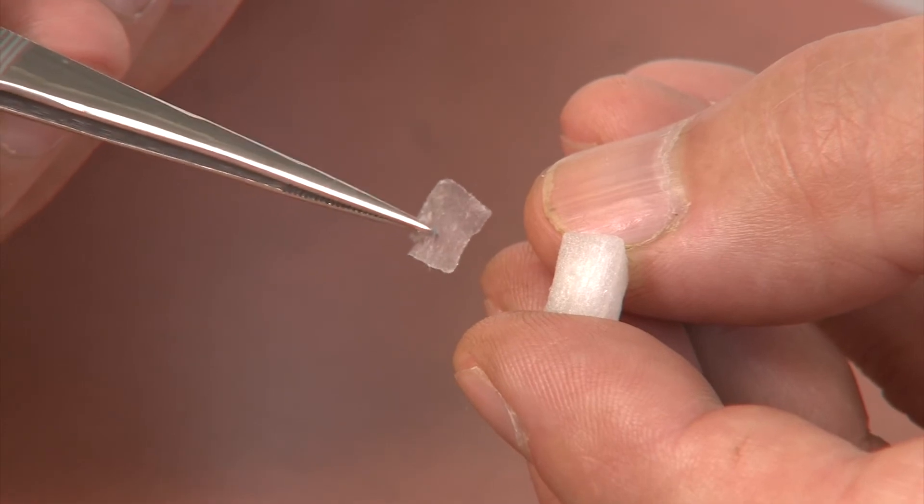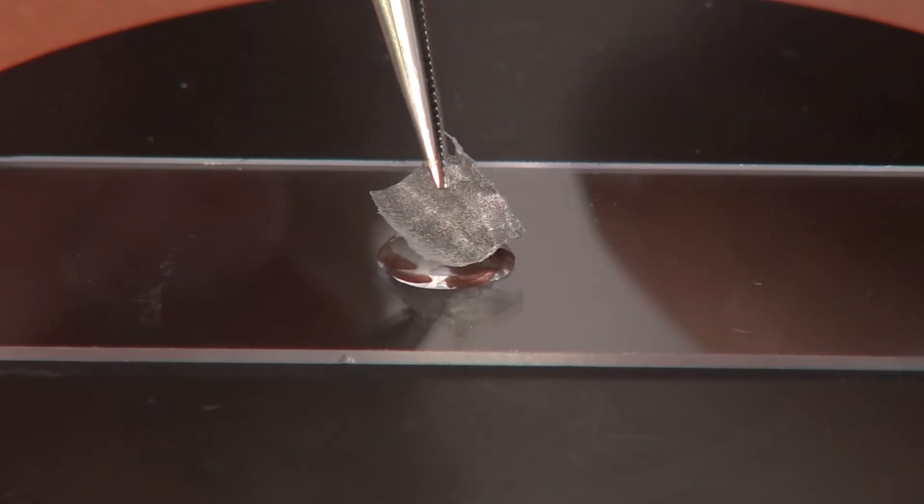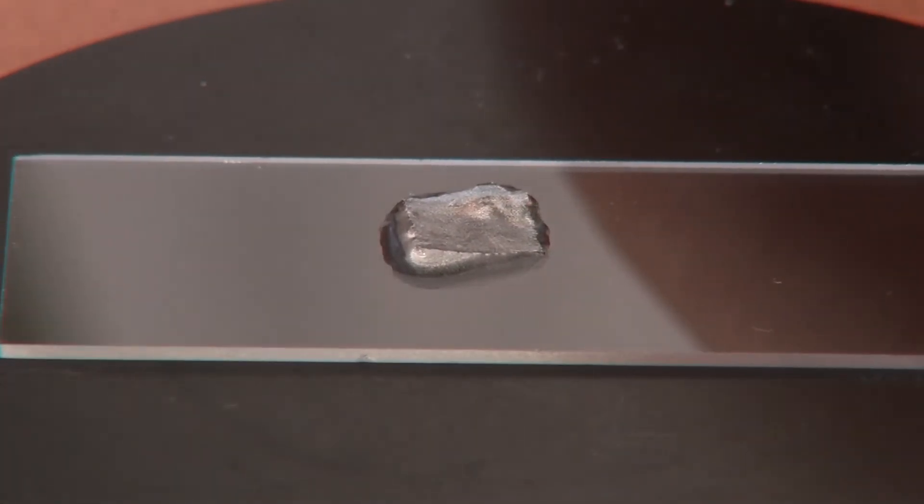This clear sheet of tissue is the epidermis. Carefully lay the epidermis in the drop of water. It should be flat, not crumpled or folded.